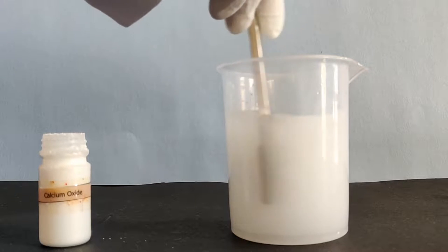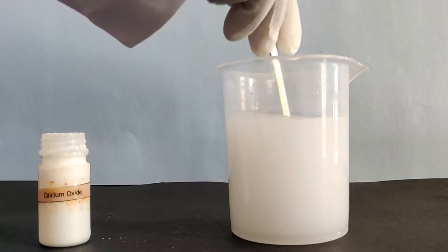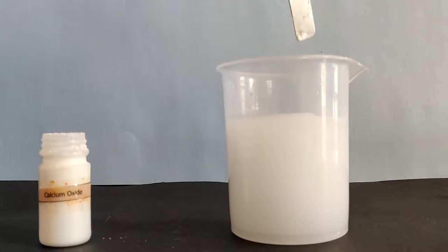You will notice a milky suspension is formed in the beaker. Now set the beaker aside for about an hour and let the suspension settle.